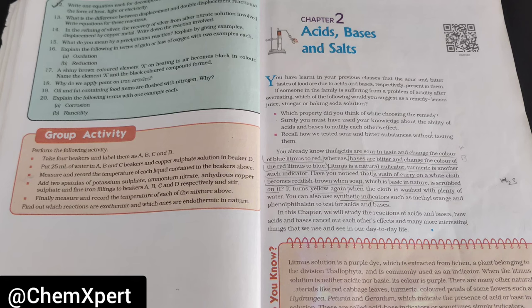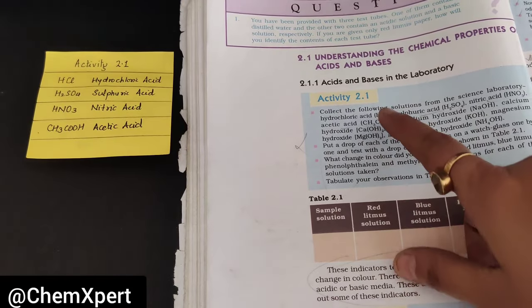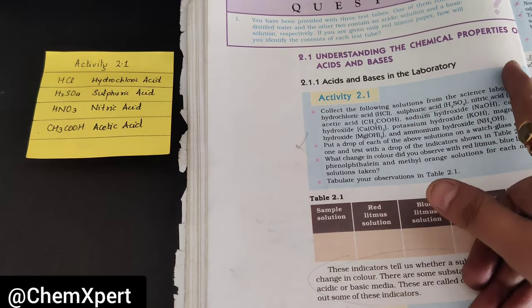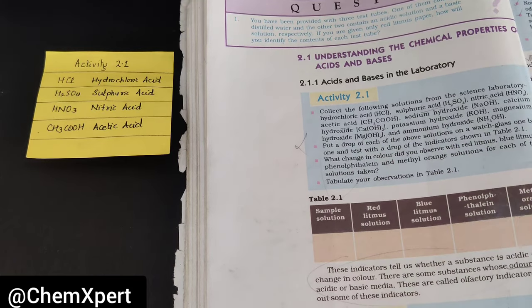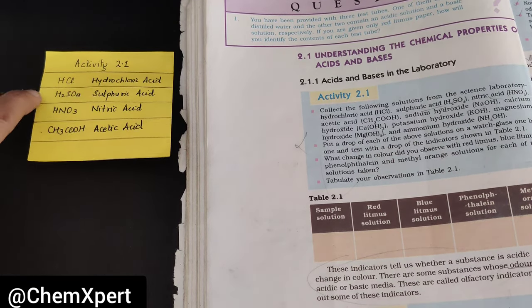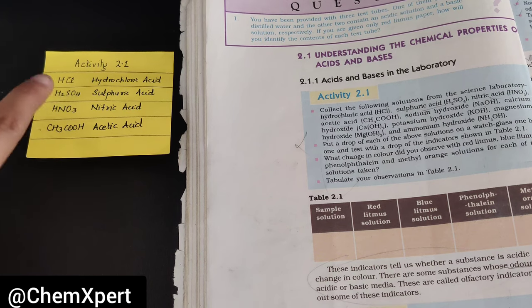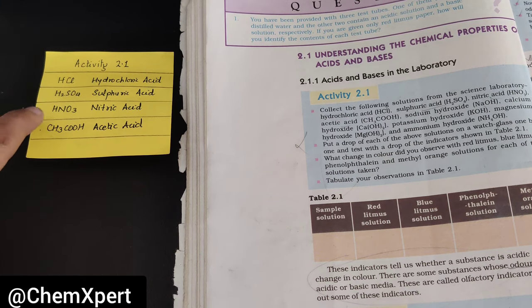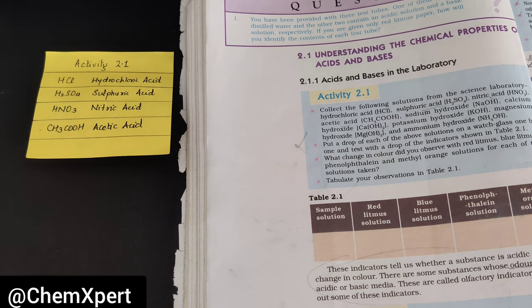So let's start the activity. The first activity is acids and bases in the laboratory, for which we have to collect different acids: HCl, H2SO4, HNO3, and CH3COOH — that is hydrochloric acid, sulfuric acid, nitric acid, and acetic acid.